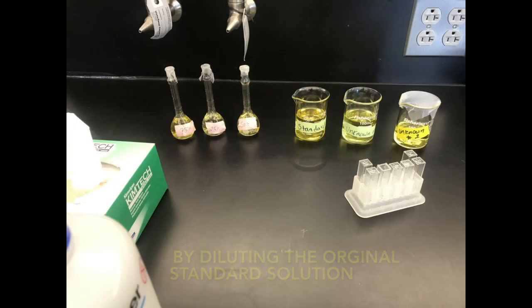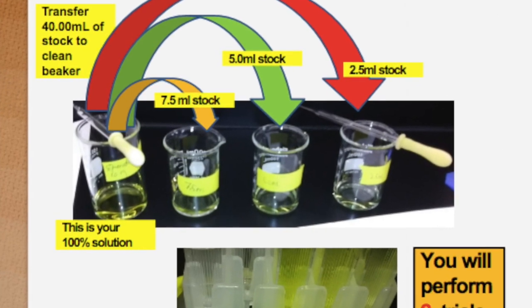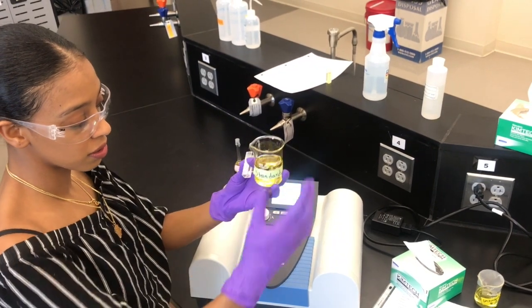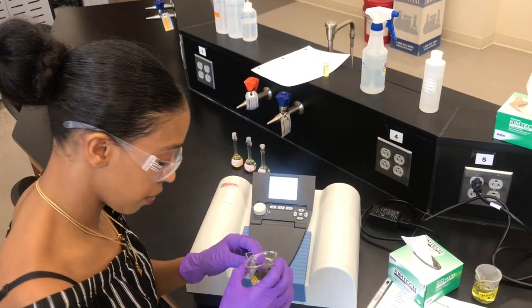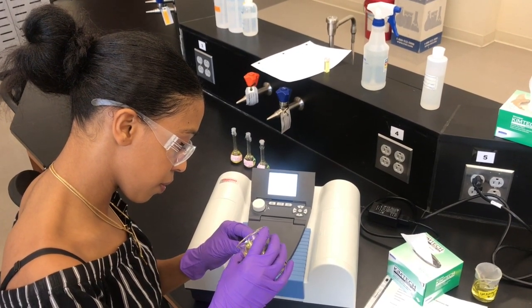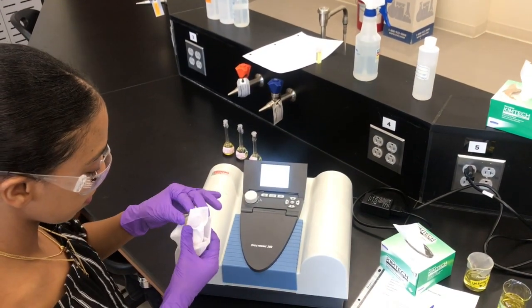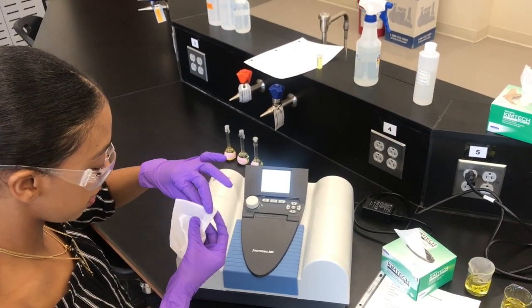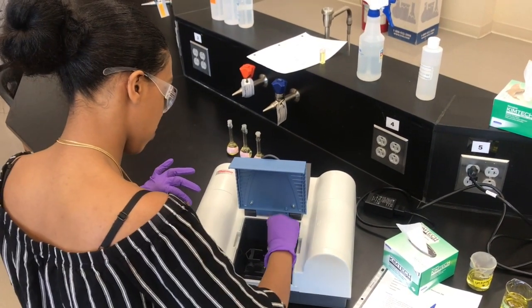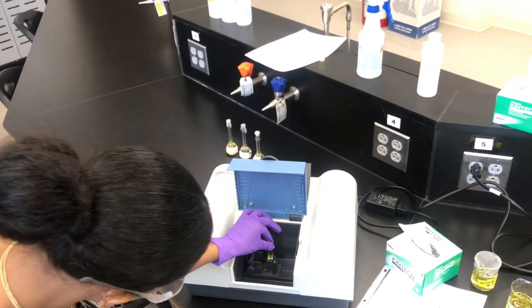Once we're done preparing our solutions to be used for our standard curve, and we have properly blanked using deionized water, the next thing to do is start collecting measurements for our standards. We're going to start by collecting data for our 100% solution, so the original one that was not diluted. Always make sure to clean your cuvette using Kim wipes, and make sure there are no bubbles, and when you insert the cuvette, make sure the clear side of the cuvette is facing the light.